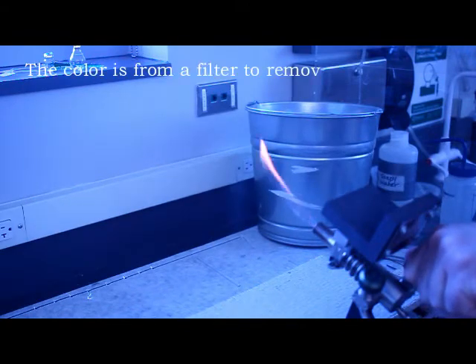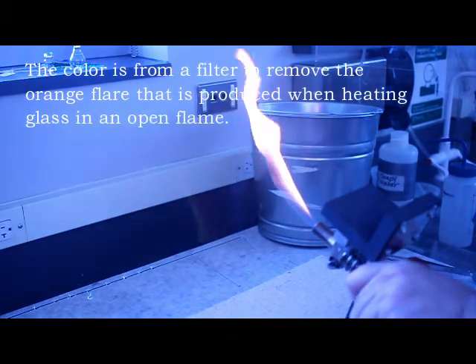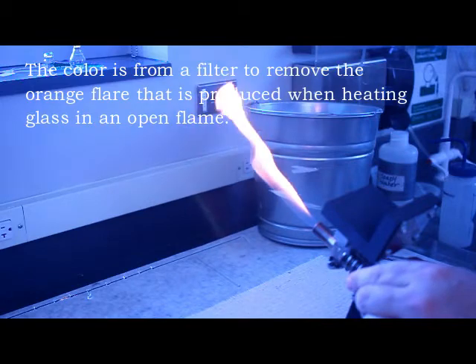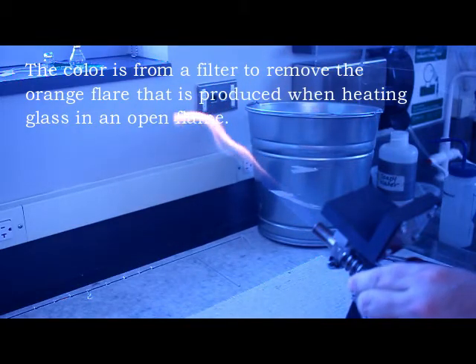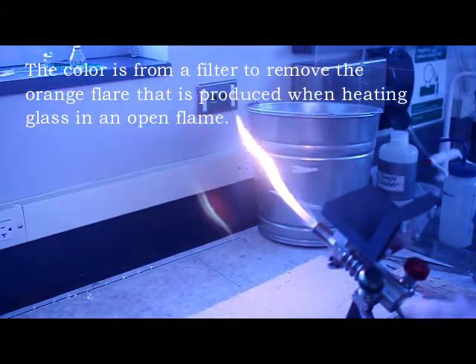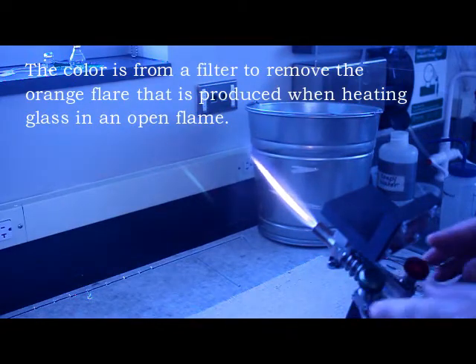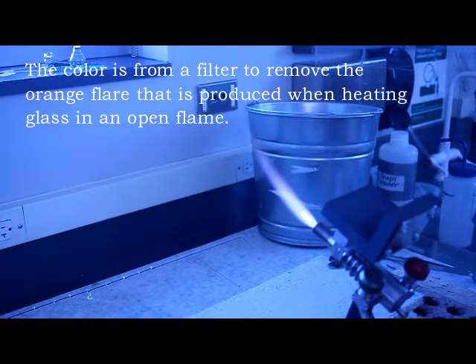In this video I want to demonstrate several techniques in scientific glass blowing. The first is making a butt seal or a straight seal, and then later on I'm going to make a side seal.